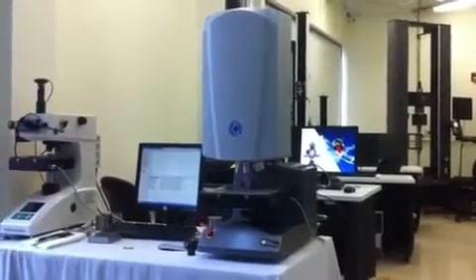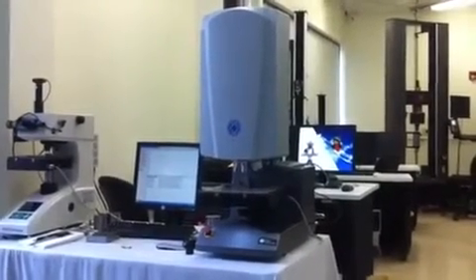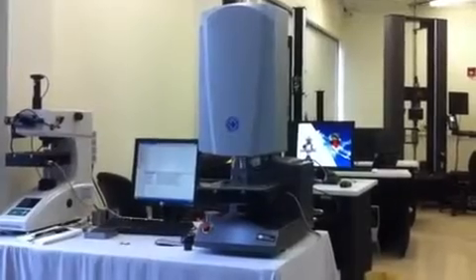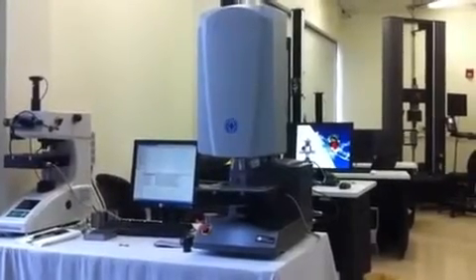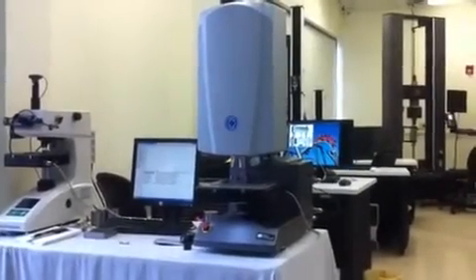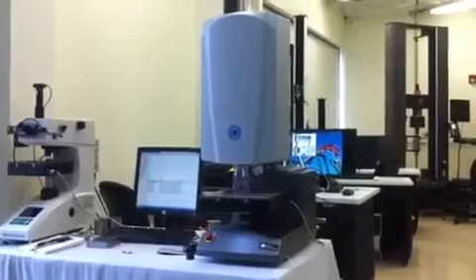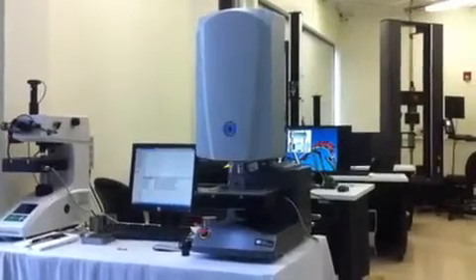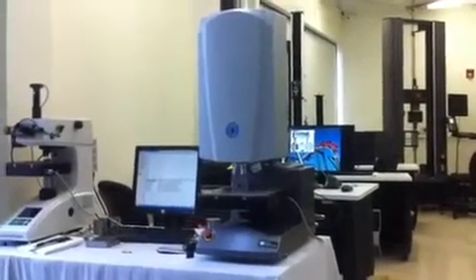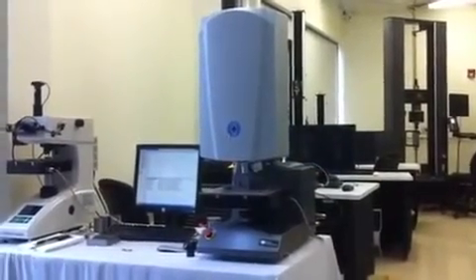This is a short video to portray the Tukon 2500 evaluating an ammunition bullet shell, trying to demonstrate the new Z-axis recognition feature for this particular system.